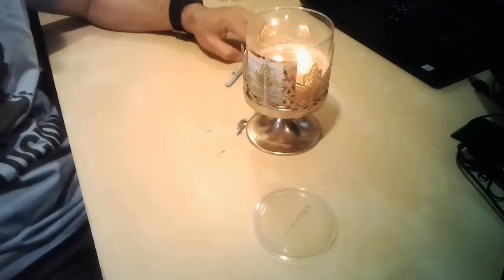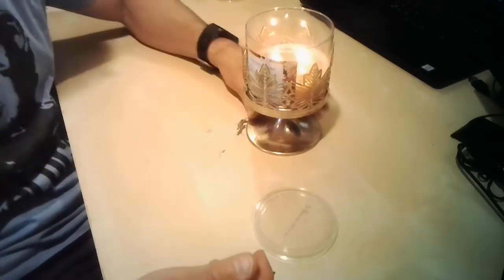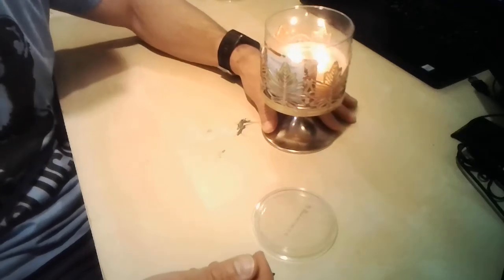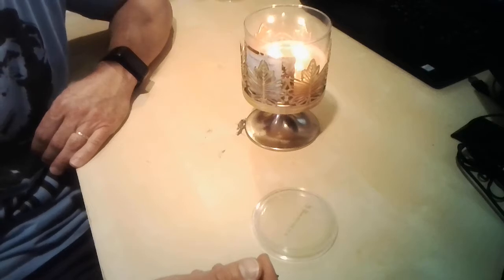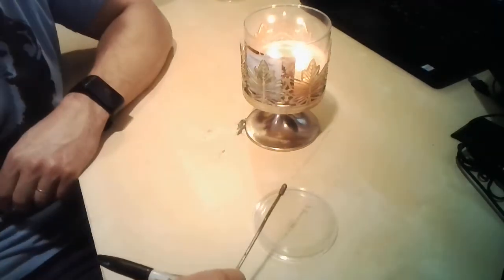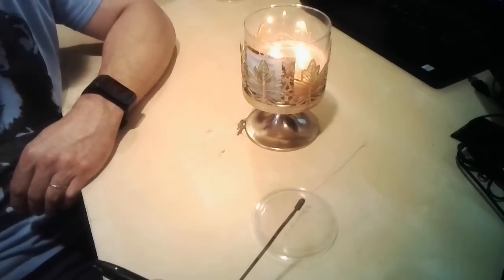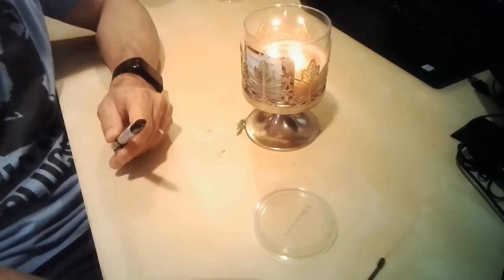We are in this strange situation in my makeshift home lab. You can see traces of me messing with the printer cartridges. Since I don't have a Bunsen burner, I'm going to be using a candle to sterilize a tool known as a wire loop. So today we will try to see how microorganisms can be carried between what we call a fomite.